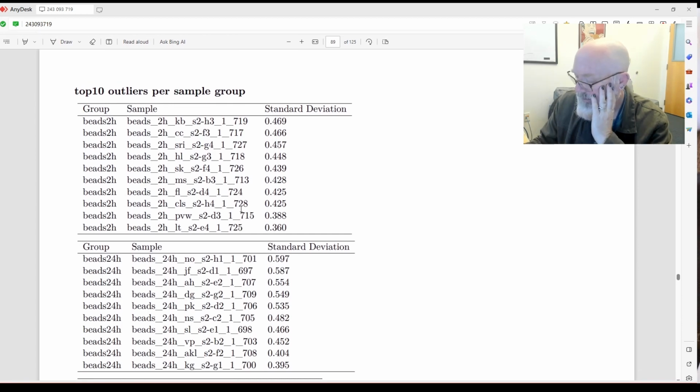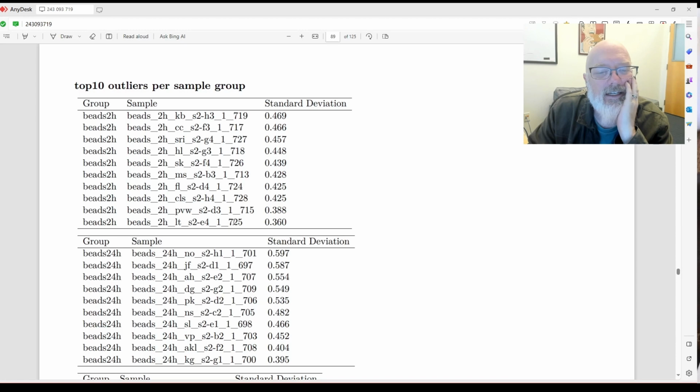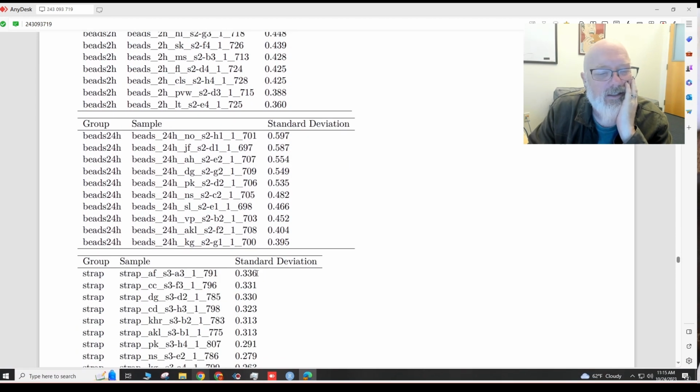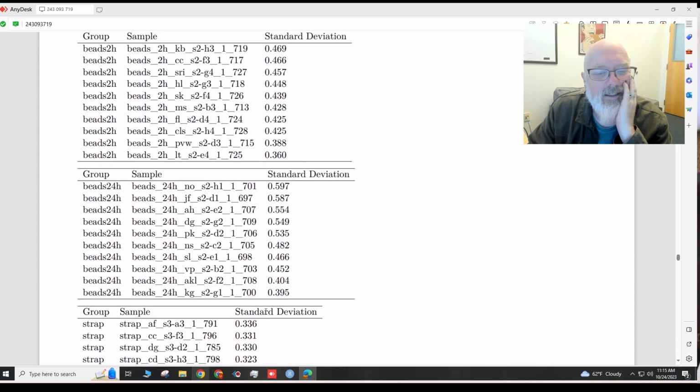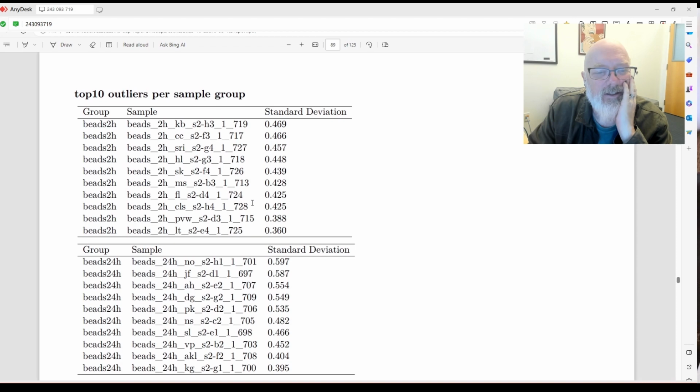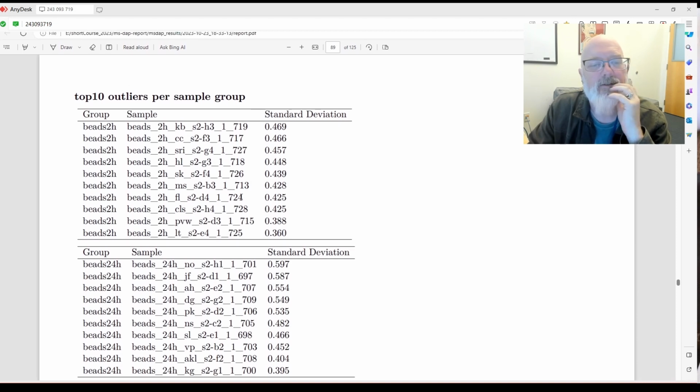723. Why isn't that an outlier? Why don't we see 723 in here? S-trap. I don't know. That's a good question. It would definitely be an outlier, wouldn't it? I don't know. I'll have to go back and see.